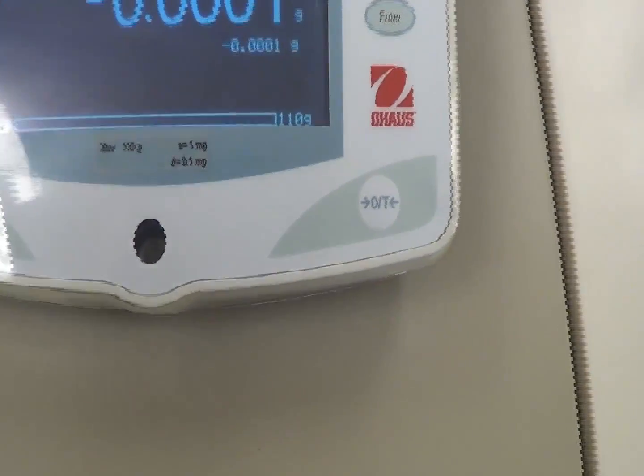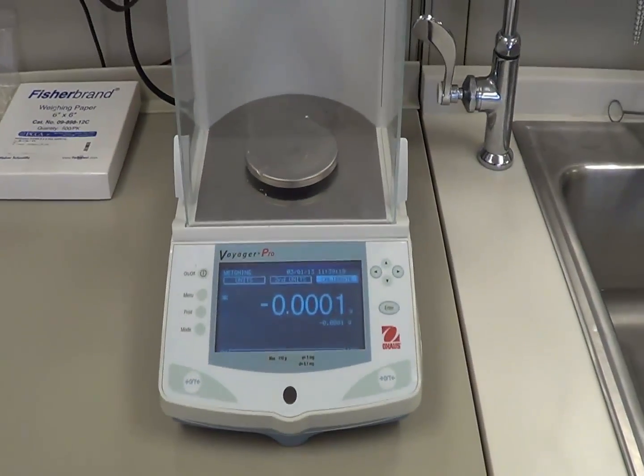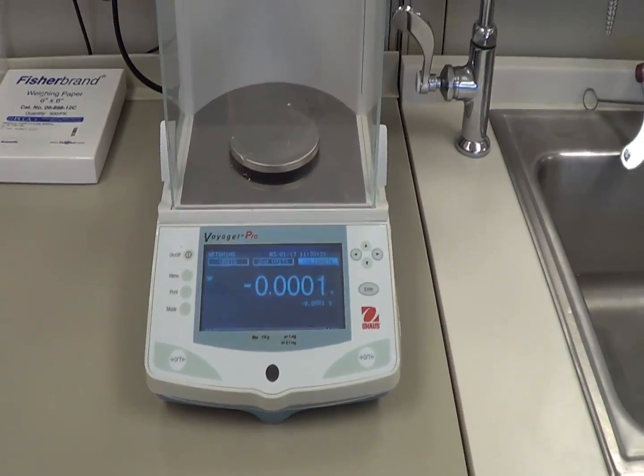When you operate, make sure, can you see the bubble in the middle? Here, this bubble should be in the middle. So let me show you, and if you notice that the bubble is not in the middle, that means it is not properly set up.